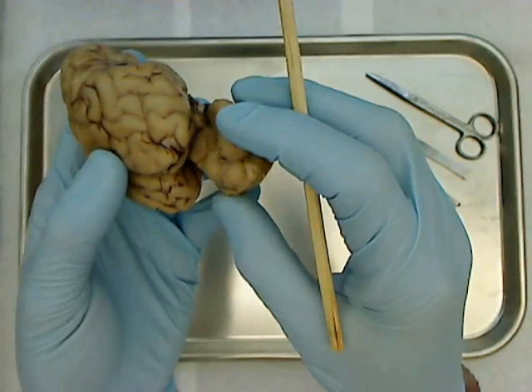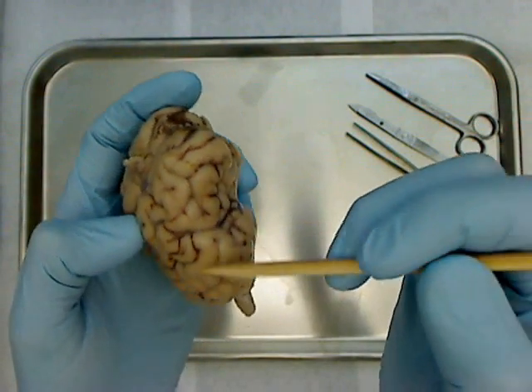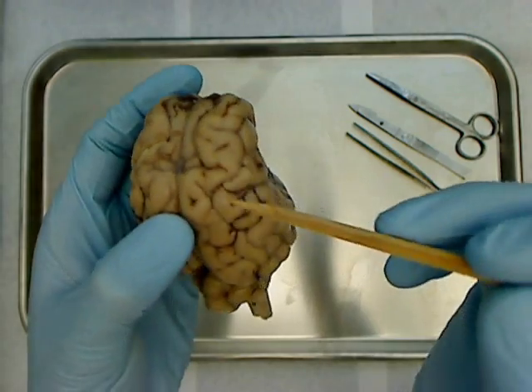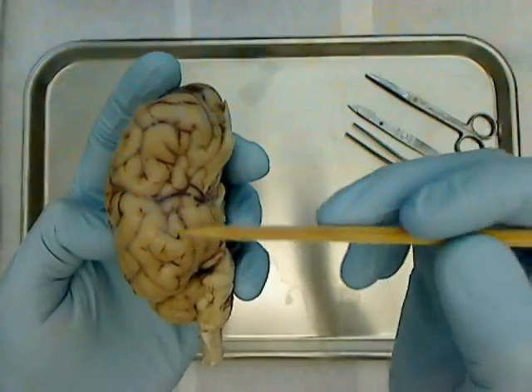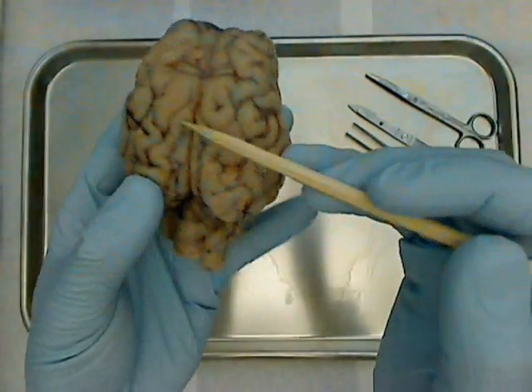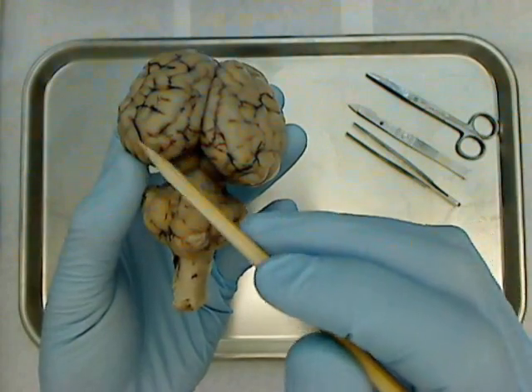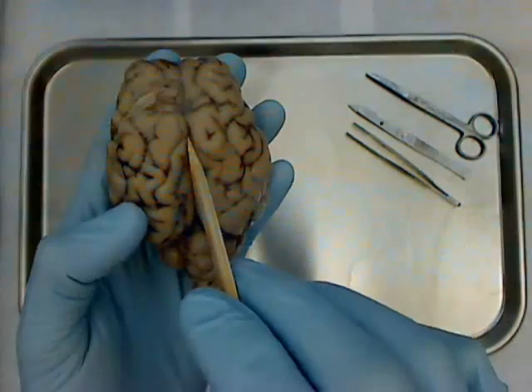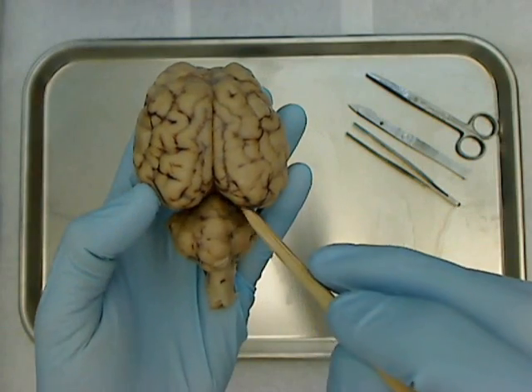You can see the cerebellum, and of course you can see the cerebrum with all of its lobes: right frontal lobe, left frontal lobe, right parietal lobe, left parietal lobe, right temporal lobe — notice that the temporal lobe does not come out as far forward as the human does — left temporal lobe, left occipital lobe, and right occipital lobe. Longitudinal fissure, or sagittal fissure, and transverse fissure.